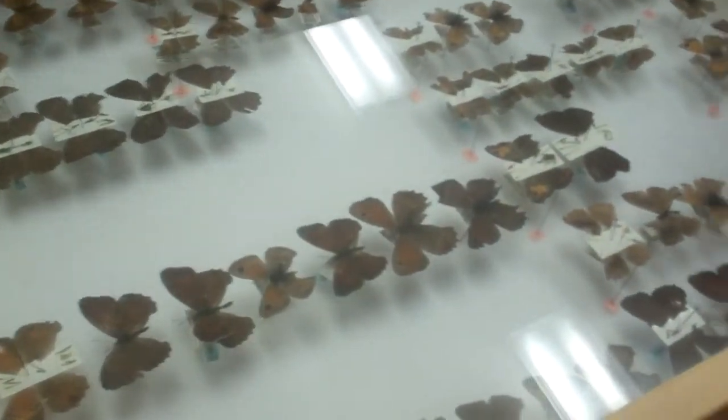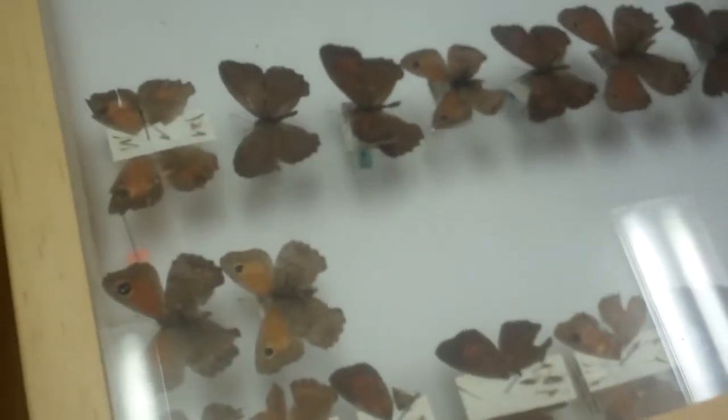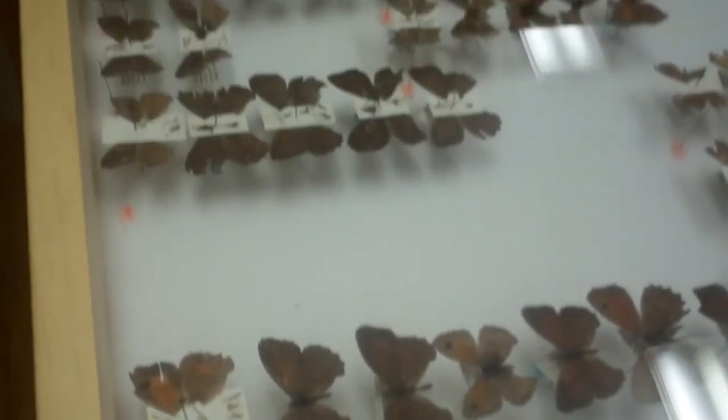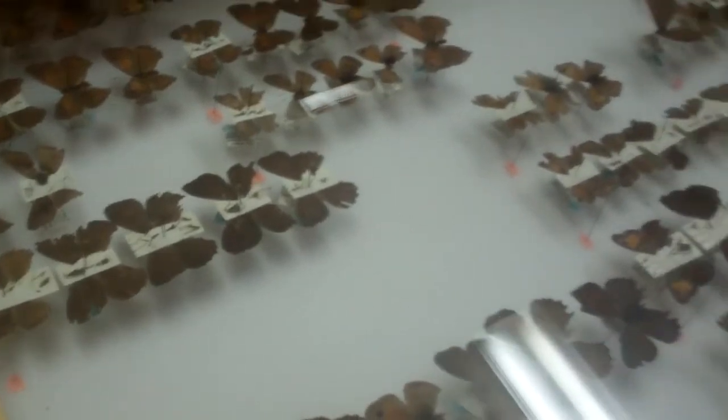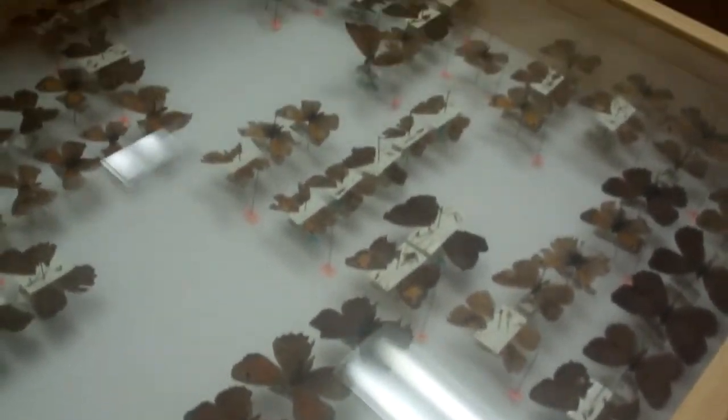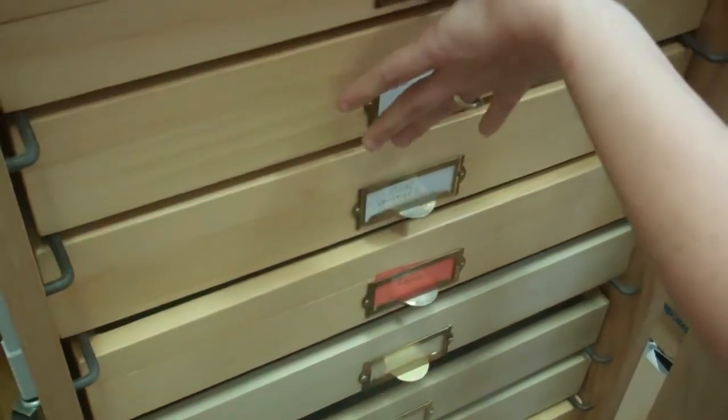Here's Dr. Brower, Jess's major professor. And here you see where I've arranged them into groups so that I can separate which ones are the same and which ones are different for my cladistic analysis. And that's a really big and fancy way of saying that I'm going to arrange them into groups.